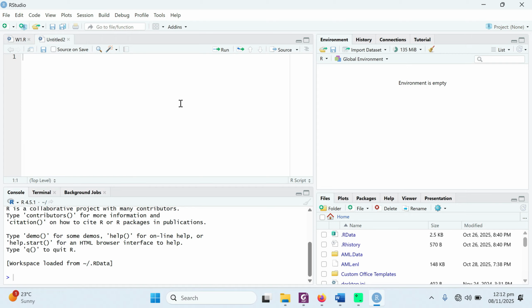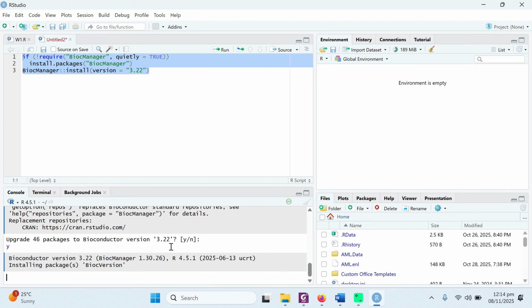You just need to paste this command over here, then select the complete command and hit the run button. When you click on the run button, it will initiate the installation. You will see an option to upgrade packages on Bioconductor. You need to type Y here and press enter. It will update. Sometimes you will see an option and you need to type A for all, which means you need to install all the packages or all the updated packages.